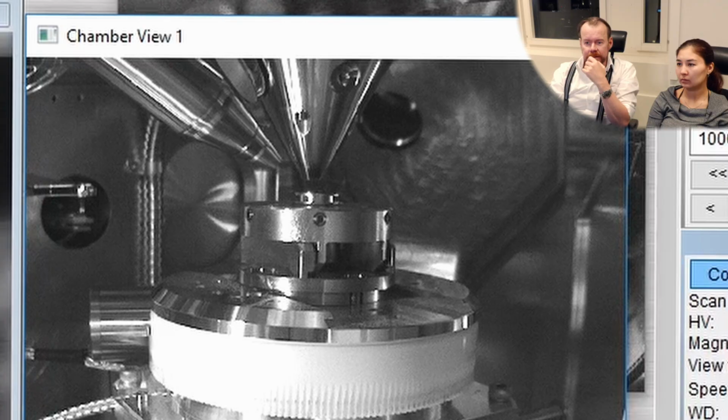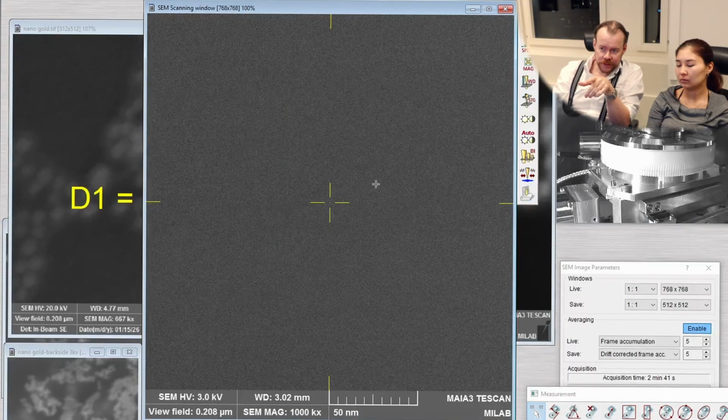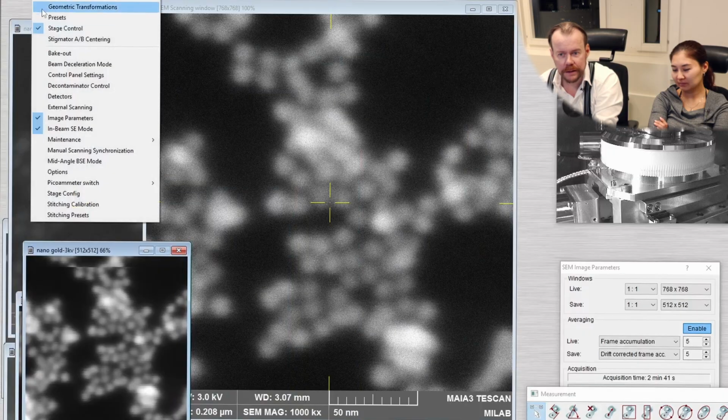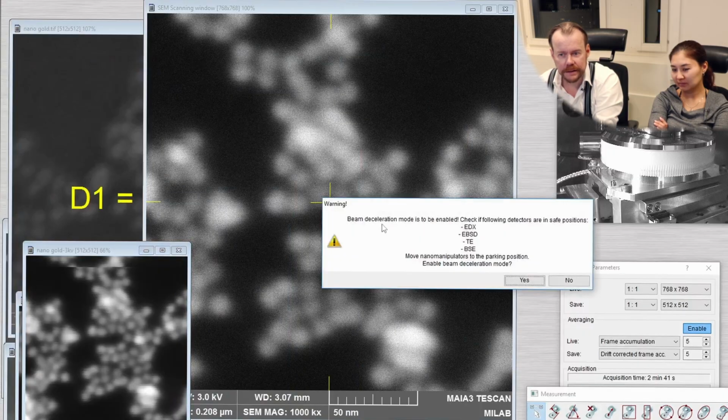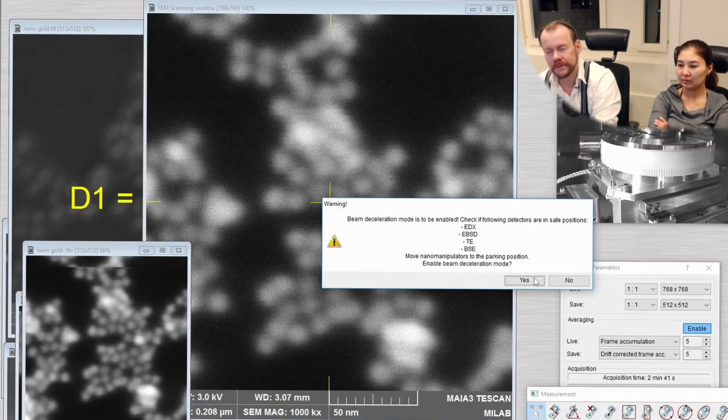We shall remove the EDS detector also before we change that. You see everything change in the picture when we do that, since the EDS detector is also metal. So let's try that. In Deceleration Mode, it says no detectors and stuff inside. There is an issue with this, and that is that you can create a spark between the stage and the pole piece, and the machine will protect itself against it, but it makes it impossible to run the sample if you create a spark.